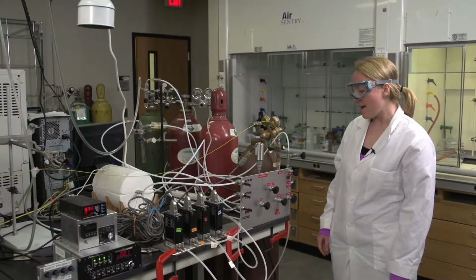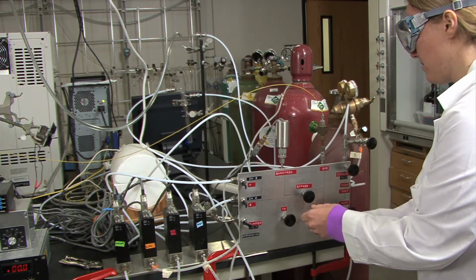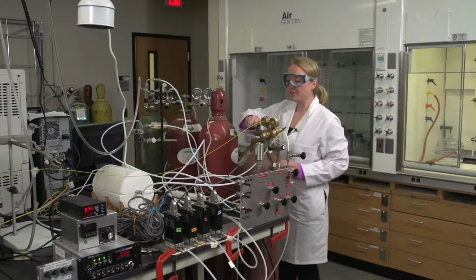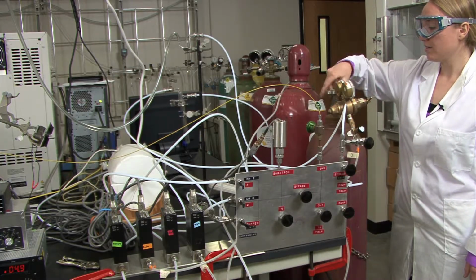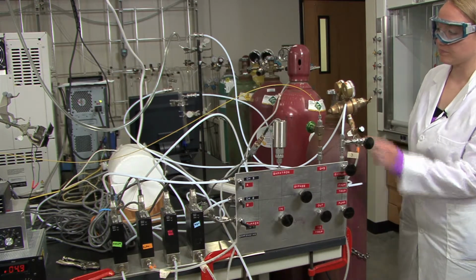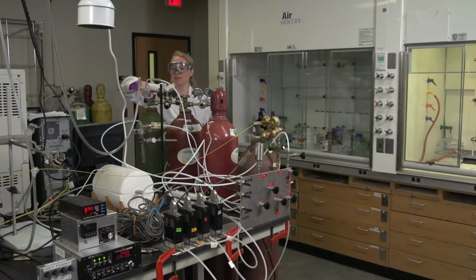So we're doing the purge on the bypass, so you'll need to open the bypass and then close in and out. And then we can come over to our gases and turn them on. Okay. So we'll turn the top valve for the ethylene on all the way, and then closing it a quarter of a turn, and then opening the needle valve. And then you'll want to do the same thing by going over to the oxygen tank, turning this on all the way.